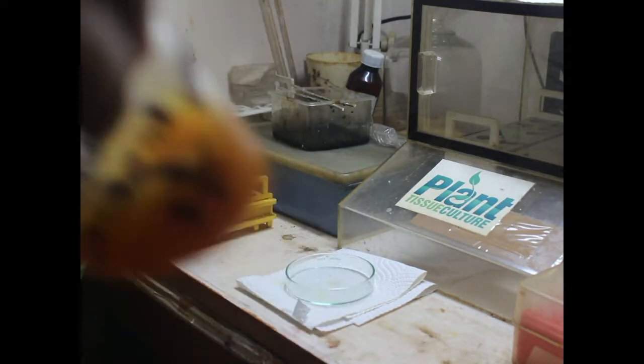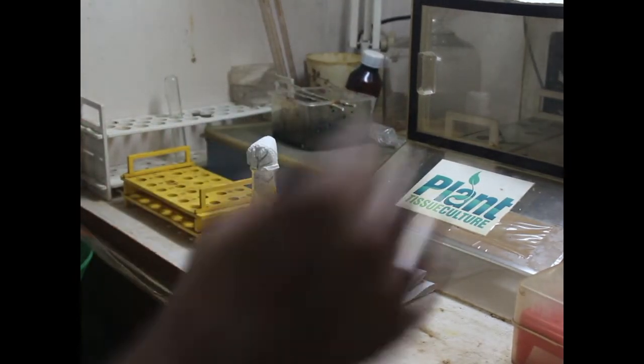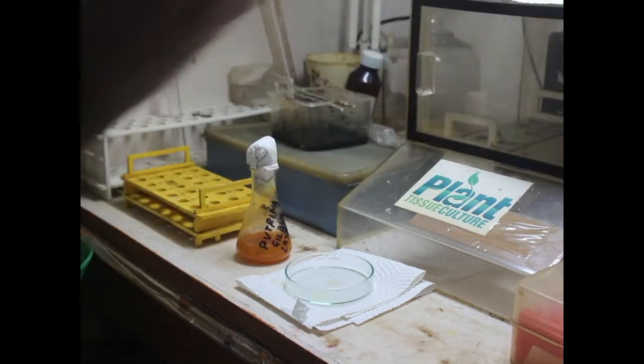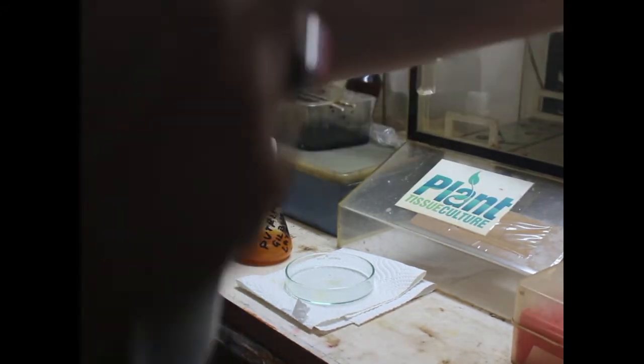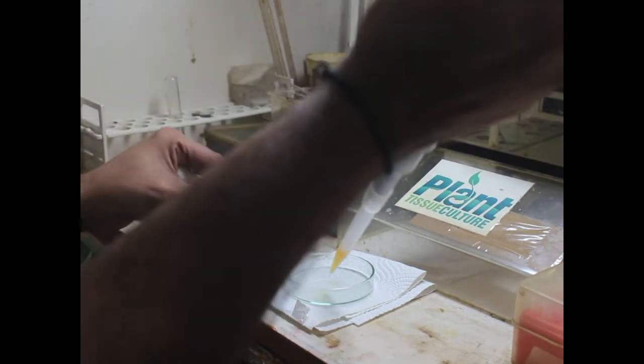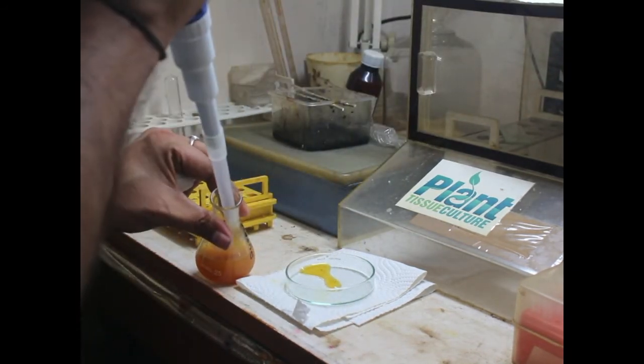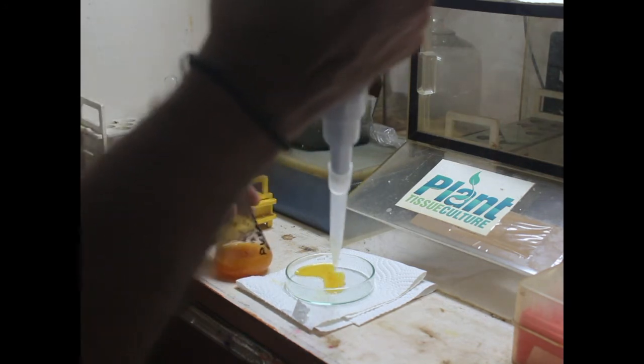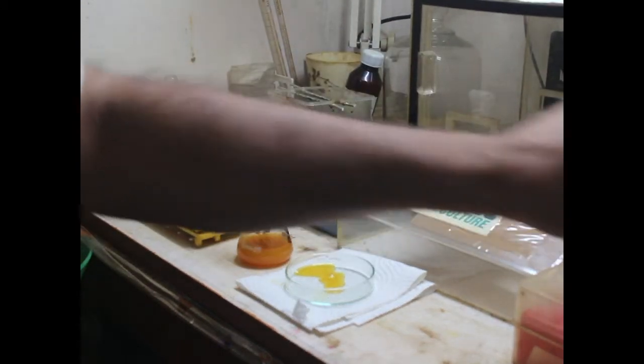So let's begin the extraction and we will be visualizing it under microscope TCM 400. We will be allocating 3 ml of the extract and we will be taking the mixture to see what is the morphology today in the morning. It's a very dense structure as you can see, so let's see what this structure shows us today.